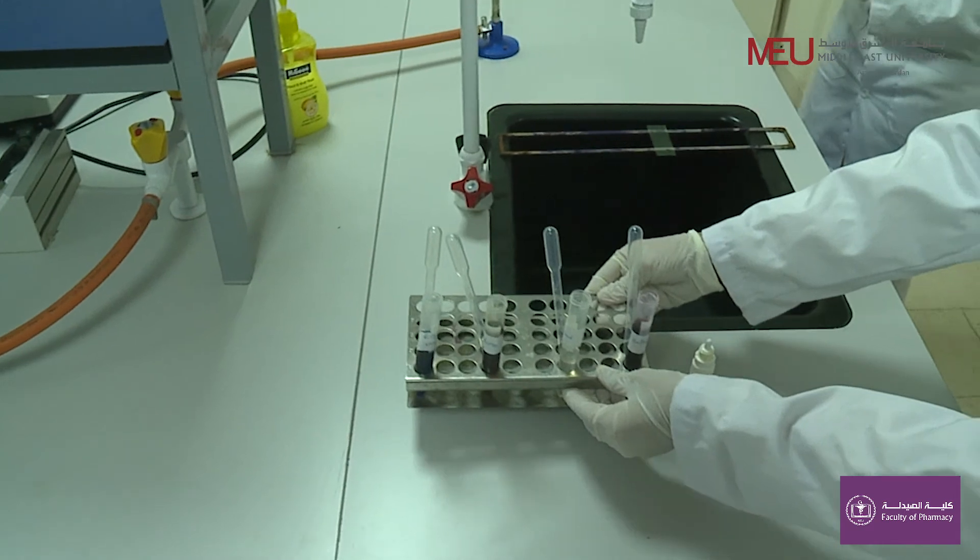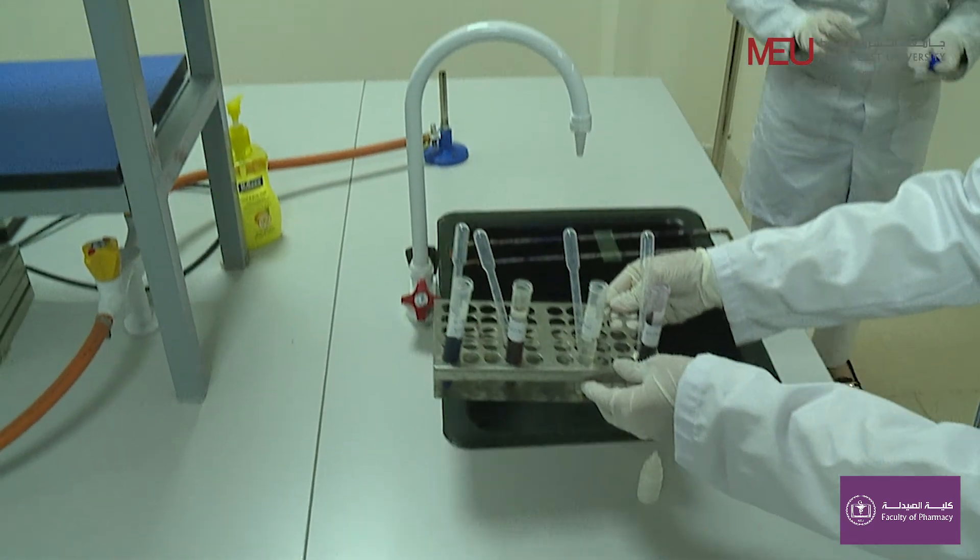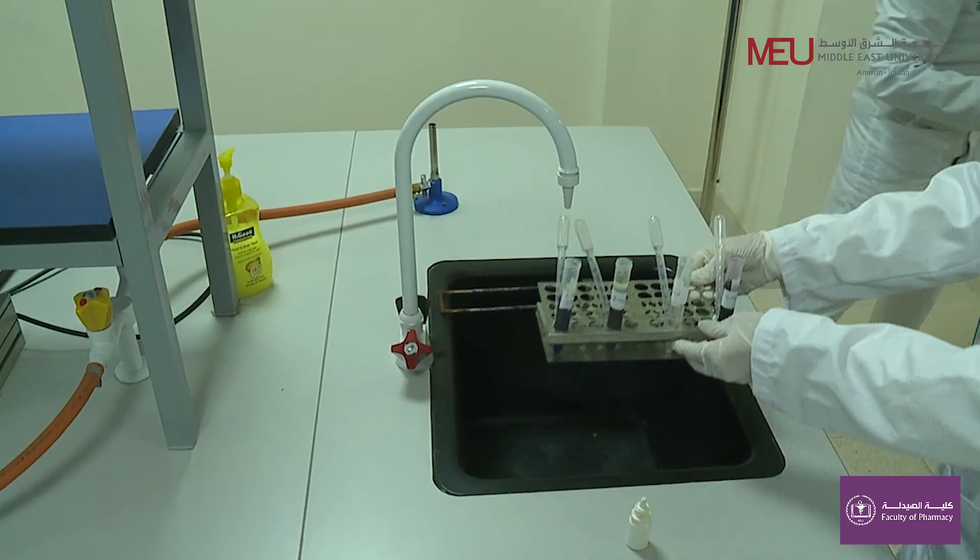After finishing, clean tools and microscope, wipe your bench and return everything to its designated place. Thank you.